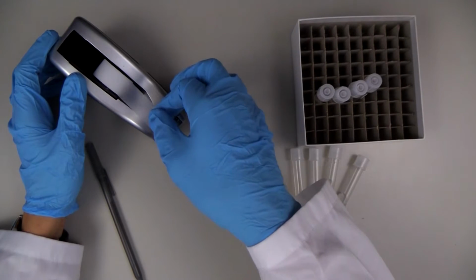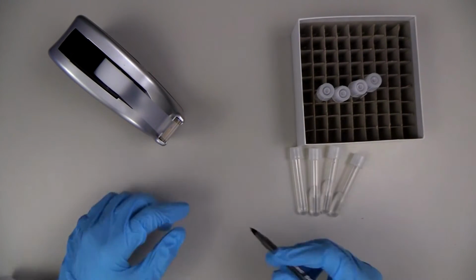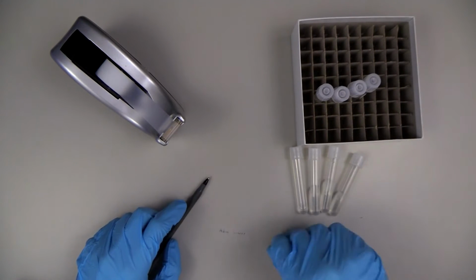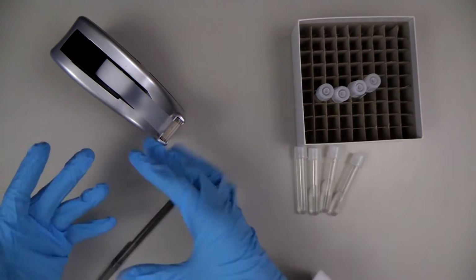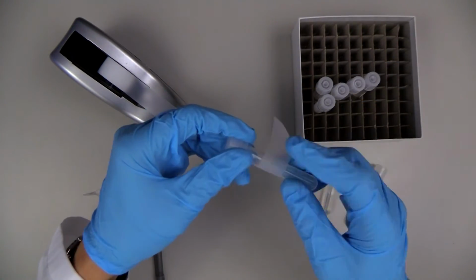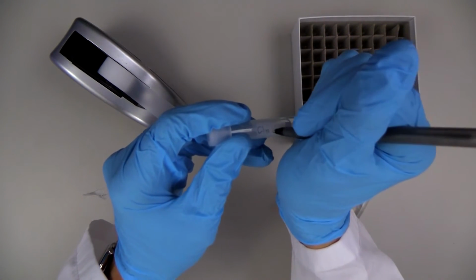All right, so it's time to ID these vials and get them ready for the lab. Nothing some trusty tape can't handle. Okay, this is not going nearly as smoothly as I thought. Let's just try applying it right to the vial. Yes, very good. All right, one down, and how many of these are we preparing again?